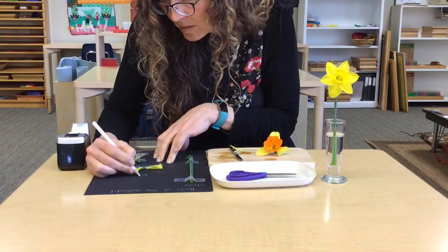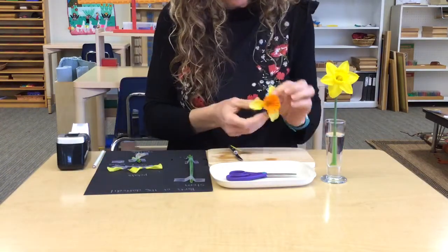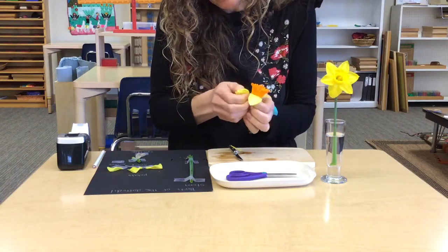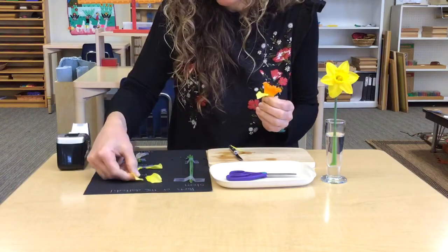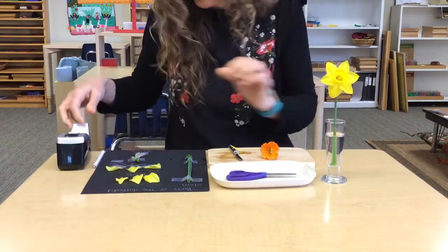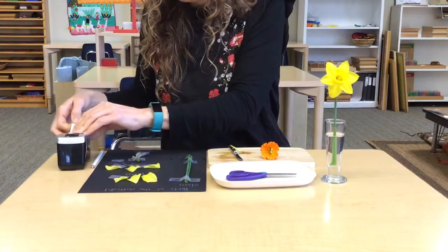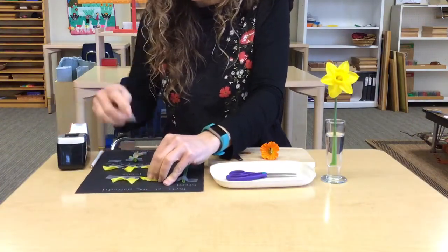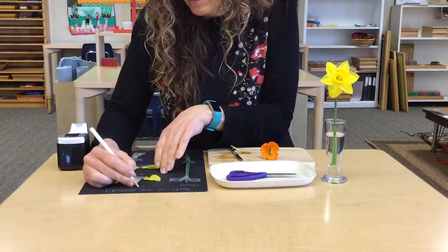And, oh gosh, am I gonna run out of room? I hope not. I have the other 3 that look very much like the petals, are called sepals. They're even spelled very much like petals. I love that about that word, sepals. All right. Sepals.